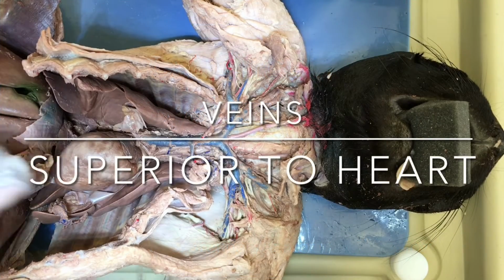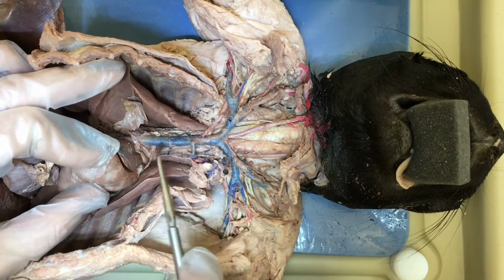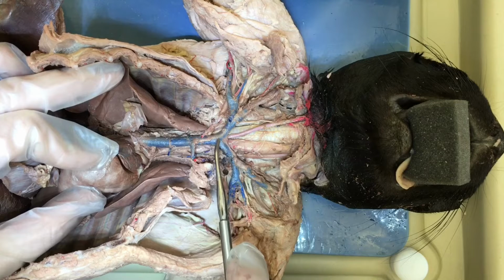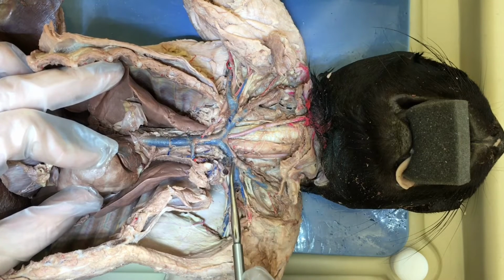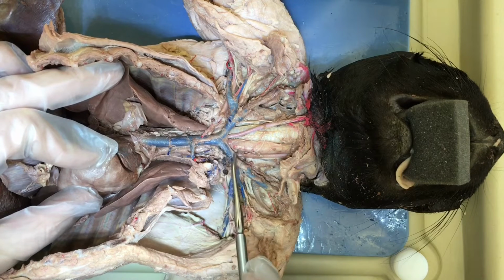All right, we're going to start with the veins superior to the heart. So we have the superior vena cava. It's coming out of the top of the heart. This is the superior vena cava. The superior vena cava branches into two branches here. These are the brachiocephalic veins.